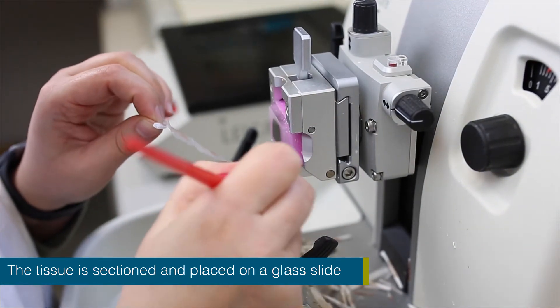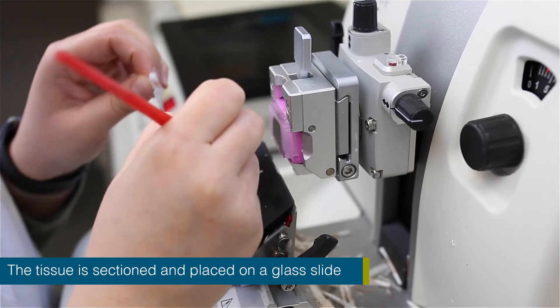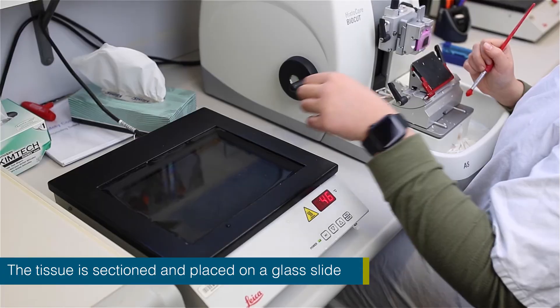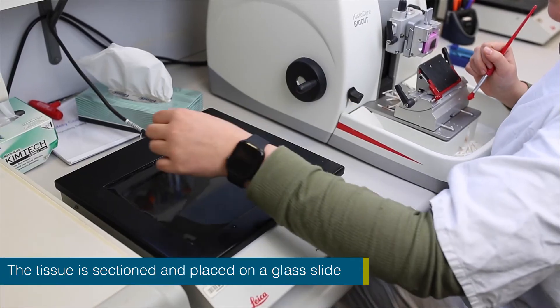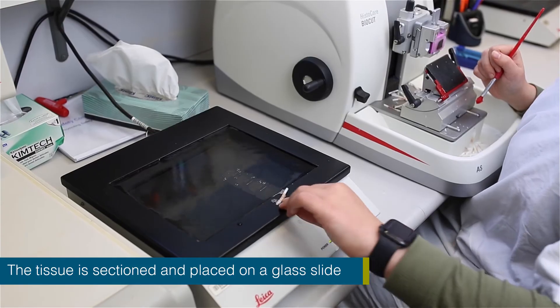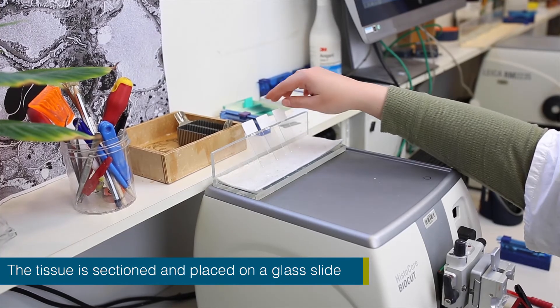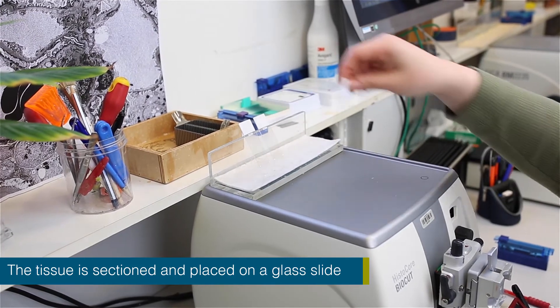The sections are placed in a water bath and are picked up by the lab staff using a plain glass slide. The glass slide is now ready to be stained.